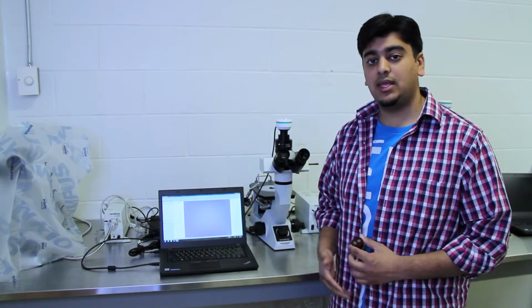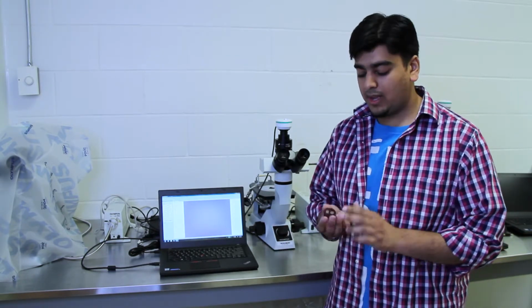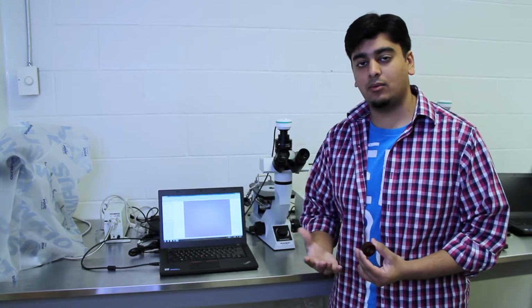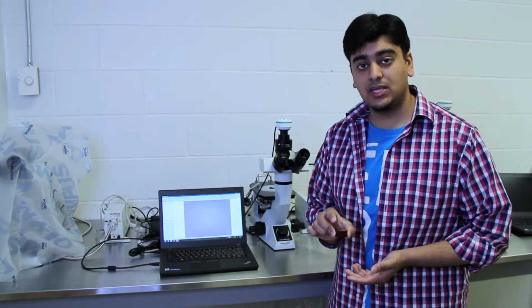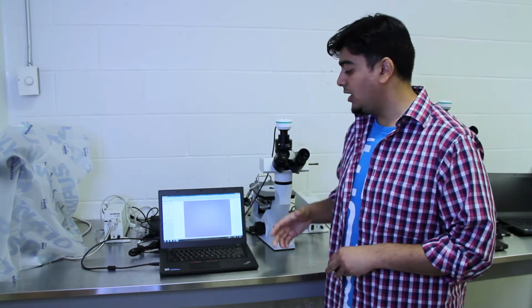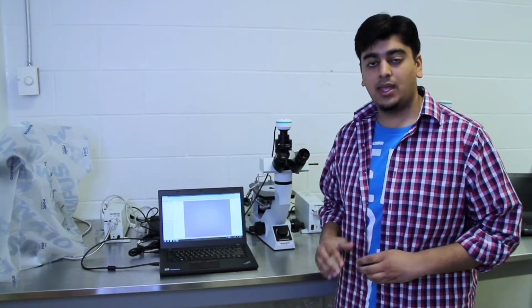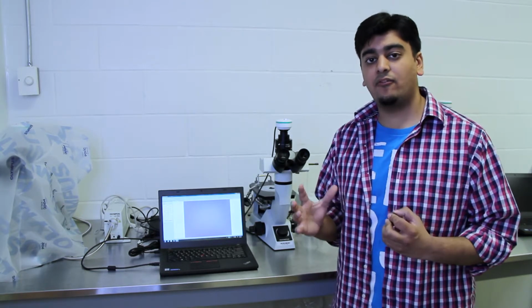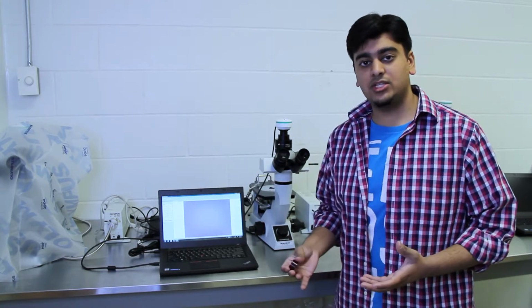However, with the inverted microscope, we have our top level is perfectly flat because we were able to make it that way. So now when we have it upside down onto the bed of the inverted microscope, it's now perfectly flat. So when we get into focus, the entire frame is in focus. The only drawback is that now the coloration on this microscope is slightly warm, a little bit more yellow, but that's okay. We can get the entire frame into focus.